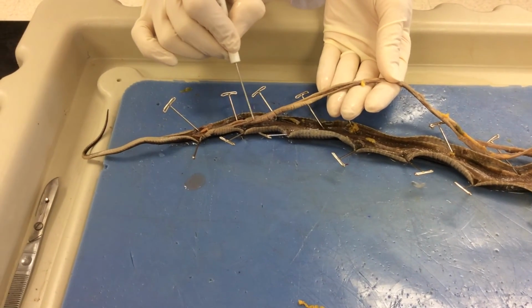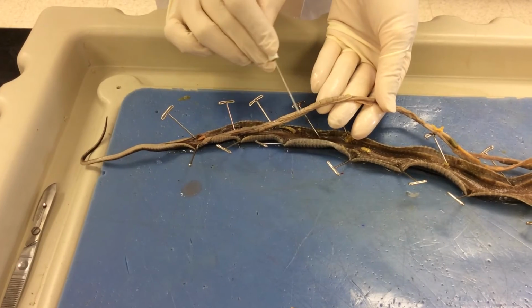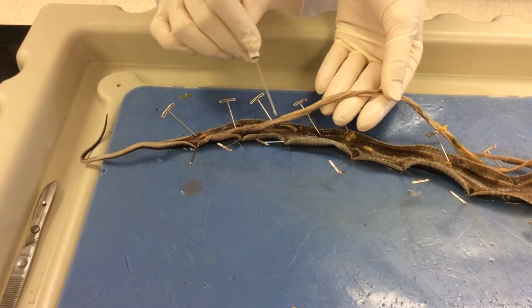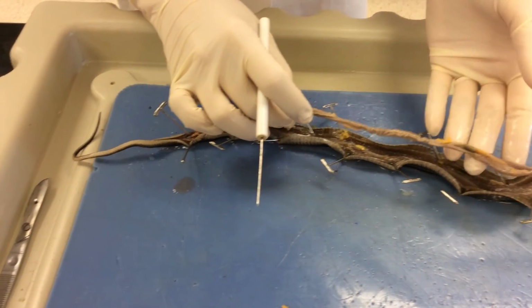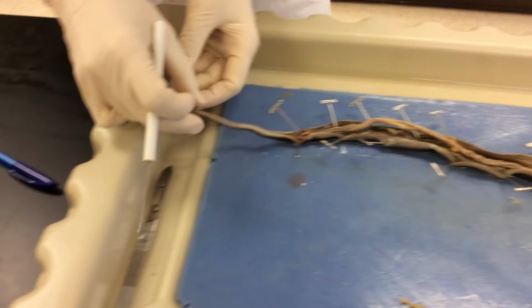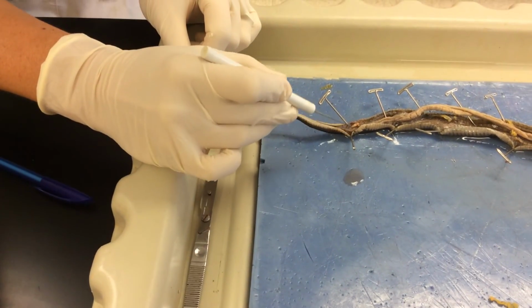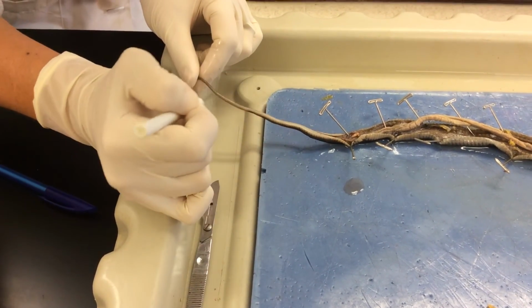This structure right here is the kidney, and it also has a counter or a matching structure on the side which regulates the blood in the body and filters out all of this waste. Down here we can look and tell that this is a male by the scales on the tail and the width after the cloaca and the length itself.